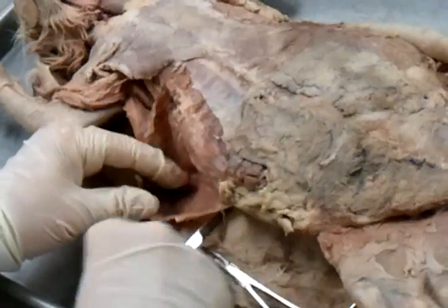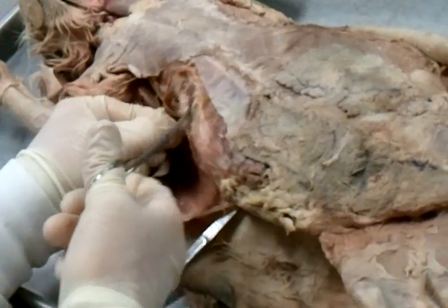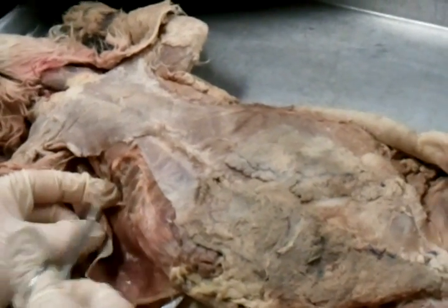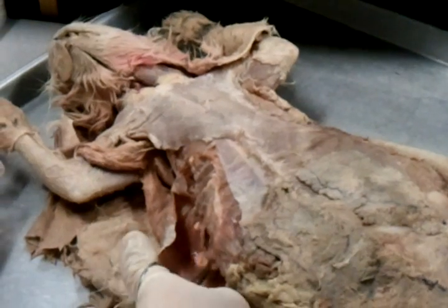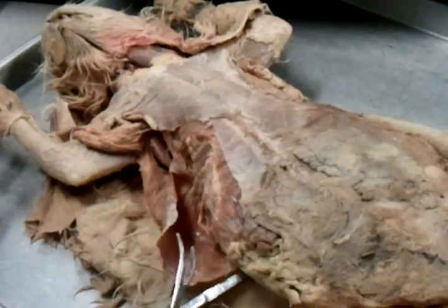So here's the deal — I'm pulling all this fat right here off. You should be able to see the ribs. Do you see the ribs? Okay, guess what the muscles in between ribs are called? Intercostals. You don't have to know external and internal, because we've actually changed that — we just want you to know what an intercostal looks like. They're the ones between ribs. It's really easy. This one's between ribs — intercostals.